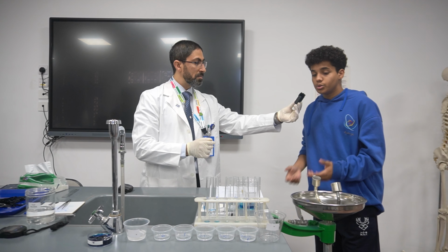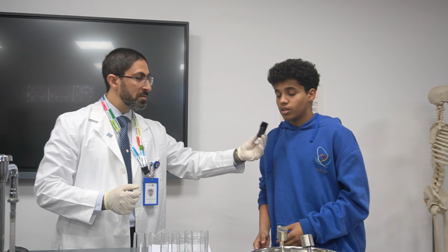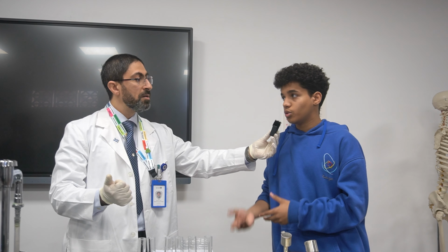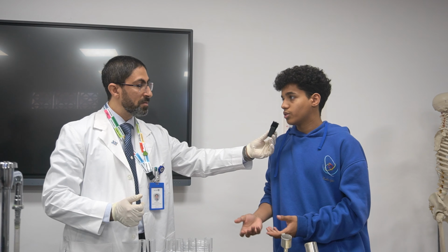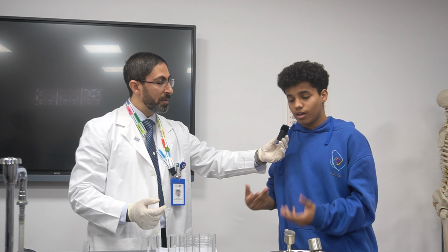Higher salt in the solution created more intensity of color in the potatoes. How can you explain this? Because water moves from high to low. High what? High water potential to lower water potential.